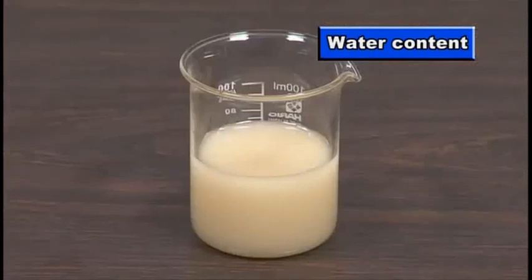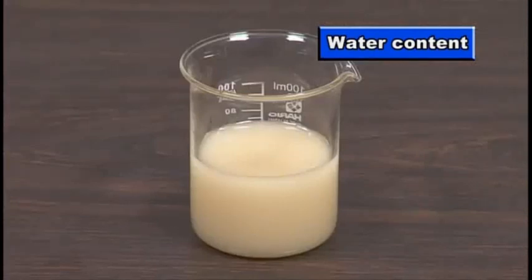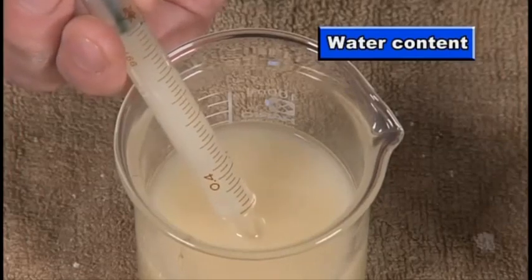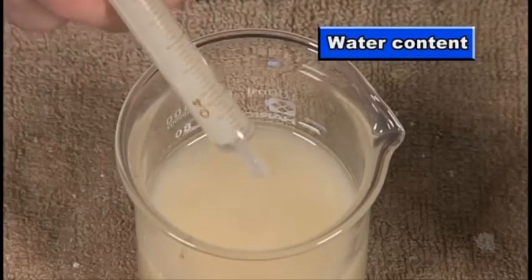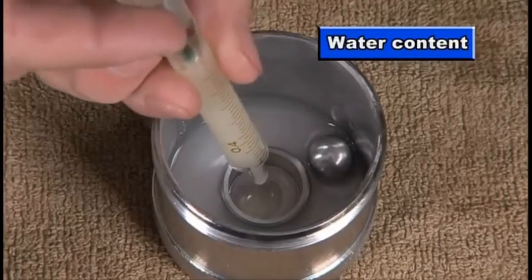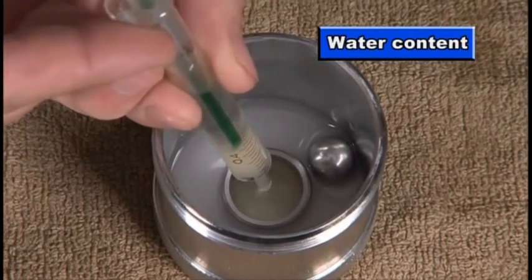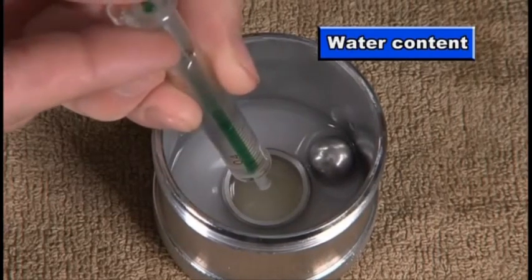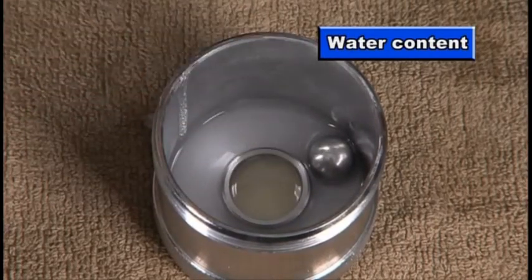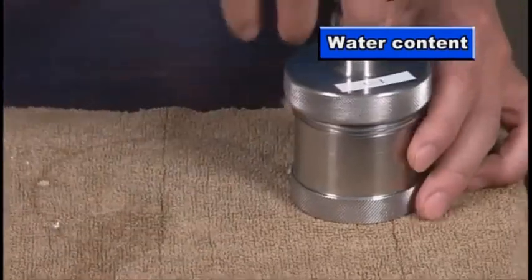Use another agent to extract water from the oil. Mix them well to develop a reaction and calculate the water content based on the pressure of the generated gas.